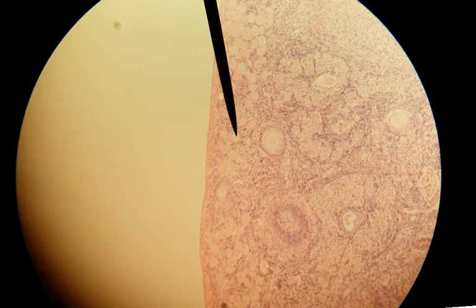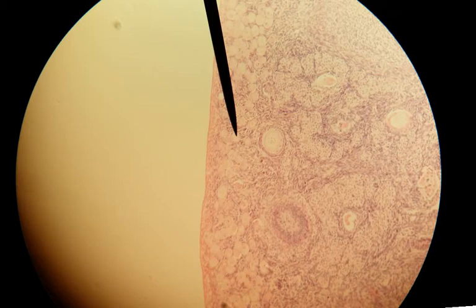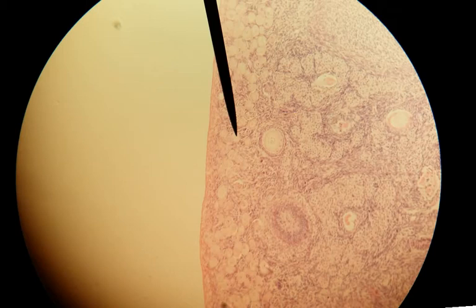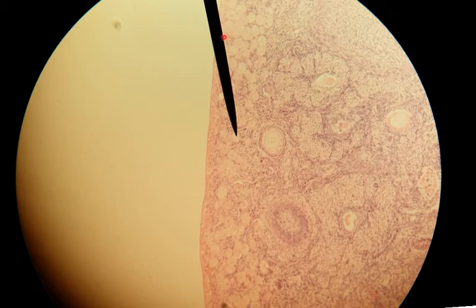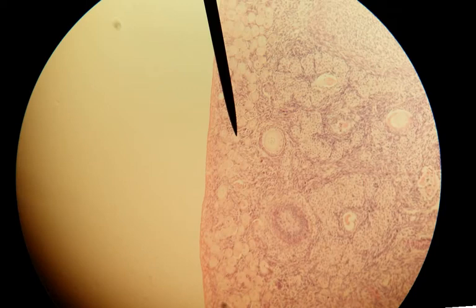Now we've moved to the ovaries, and there are several ovary slides with quite a bit to know about the development of eggs. One key difference between women and men is that men make sperm throughout their life, but women, when they're born, have all of the eggs they will ever have. Those eggs are clustered along the edge in a really underdeveloped state, and some of them will begin to mature, going through different stages that look noticeably different.